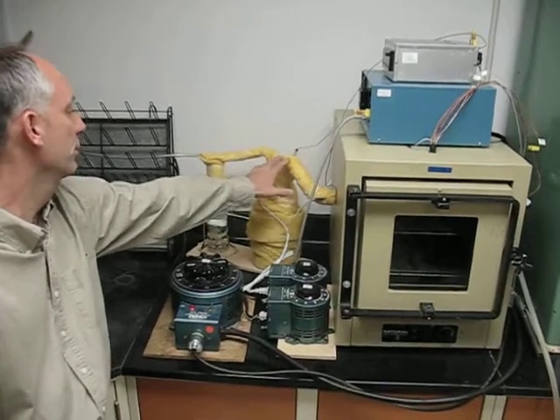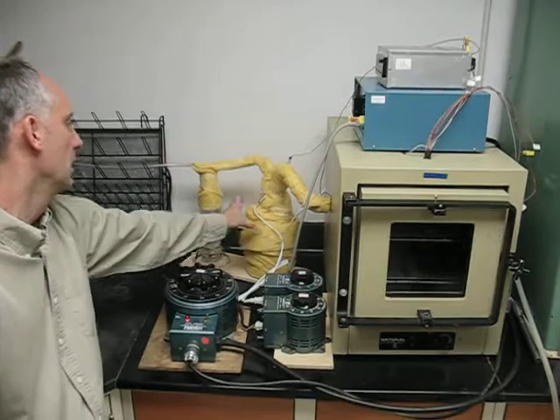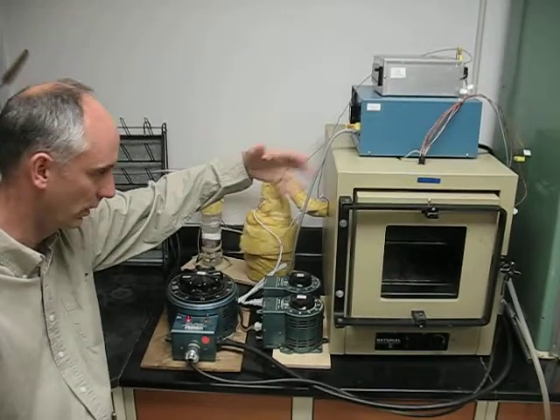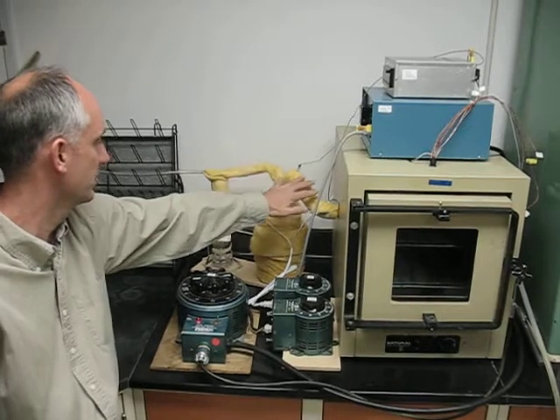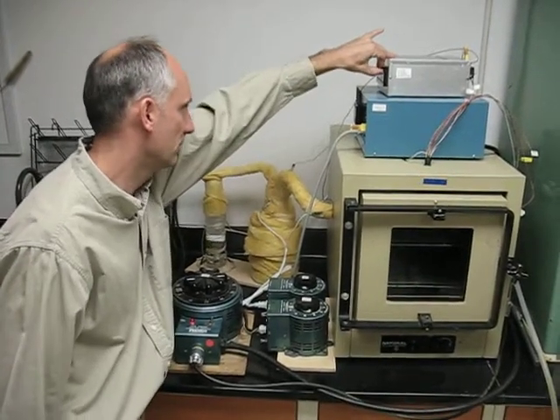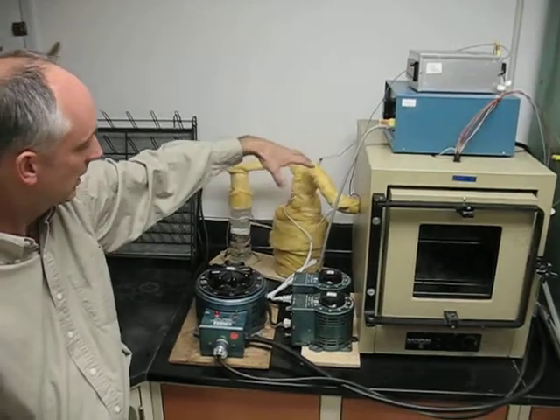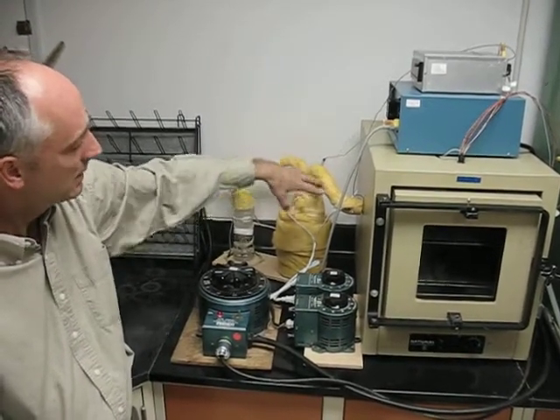And then we have a heater, both to prevent condensation. Without any heating on the transfer tube, it would all condense out at room temperature into a liquid and pour into the oven. So we've placed a heater controlled by a rheostat that we are keeping at roughly 70 degrees C, and in addition to preventing any condensation at this point, it's heating the air.